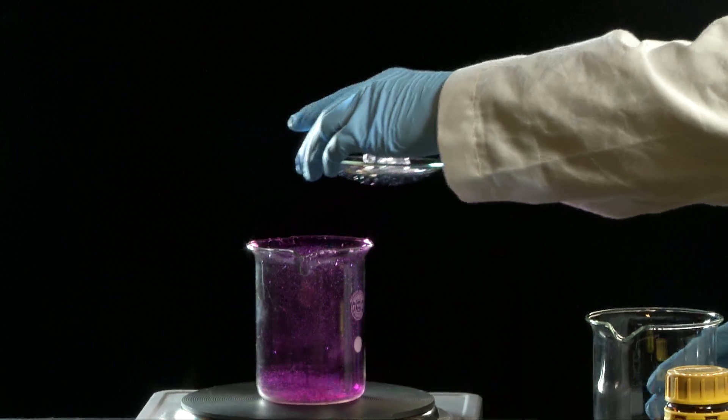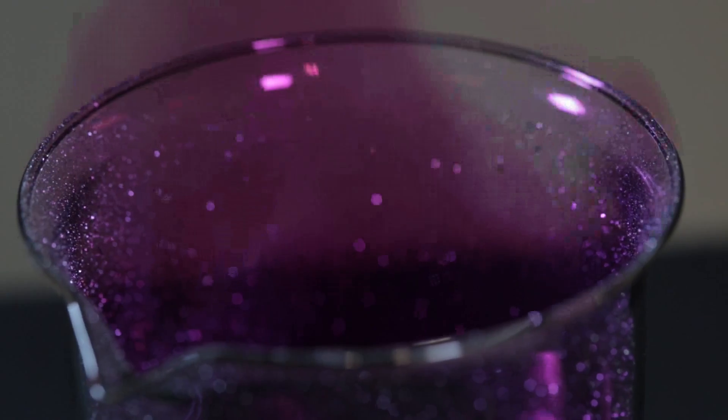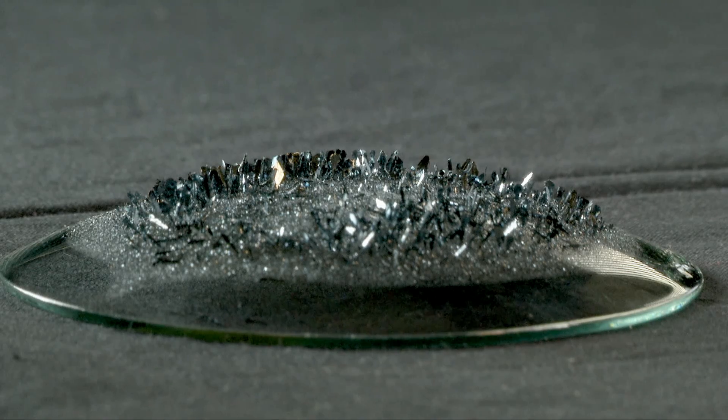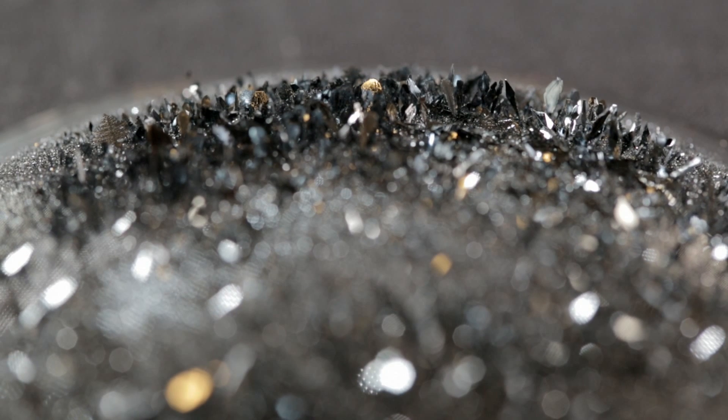Our experiment lasted only a matter of minutes, but in that time, a thick layer of crystals were deposited onto the watch glass. Sublimation is for example used by chemists to purify compounds and in freezers to avoid ice formation.